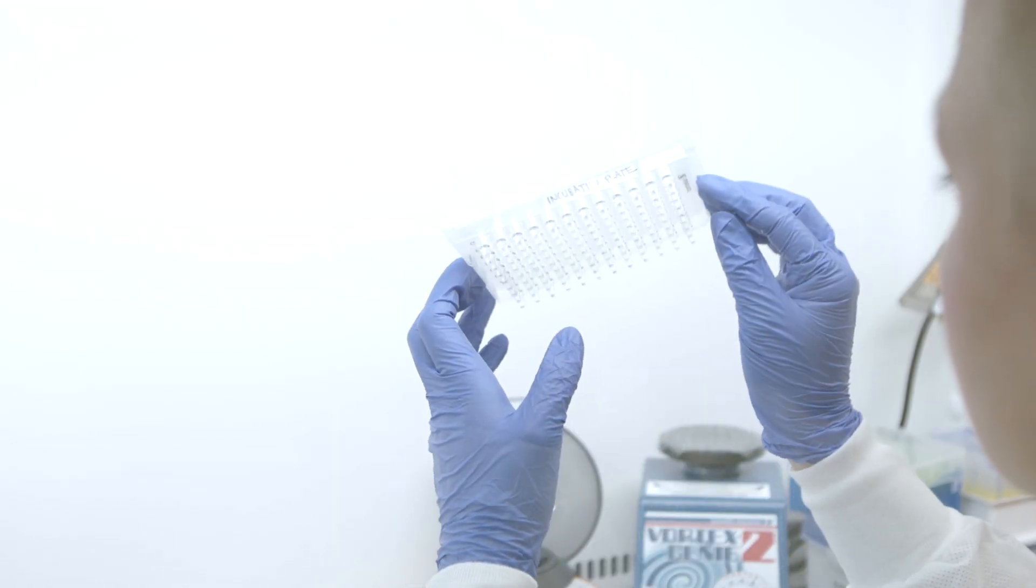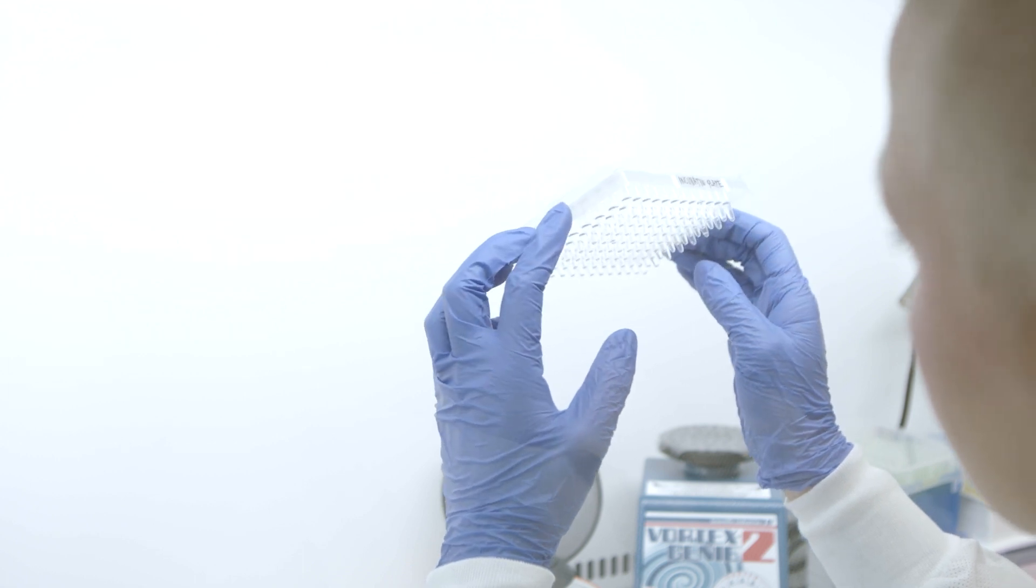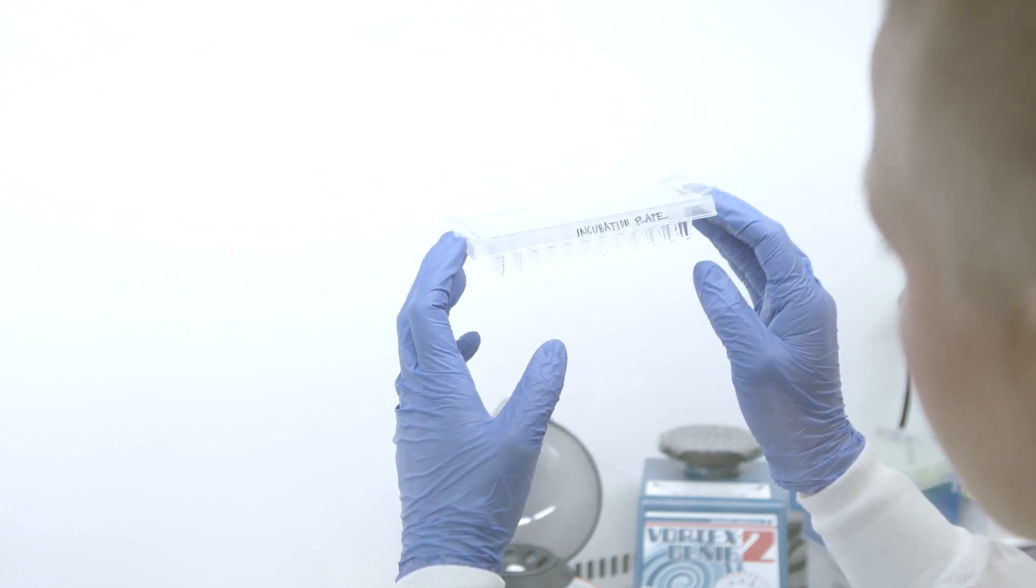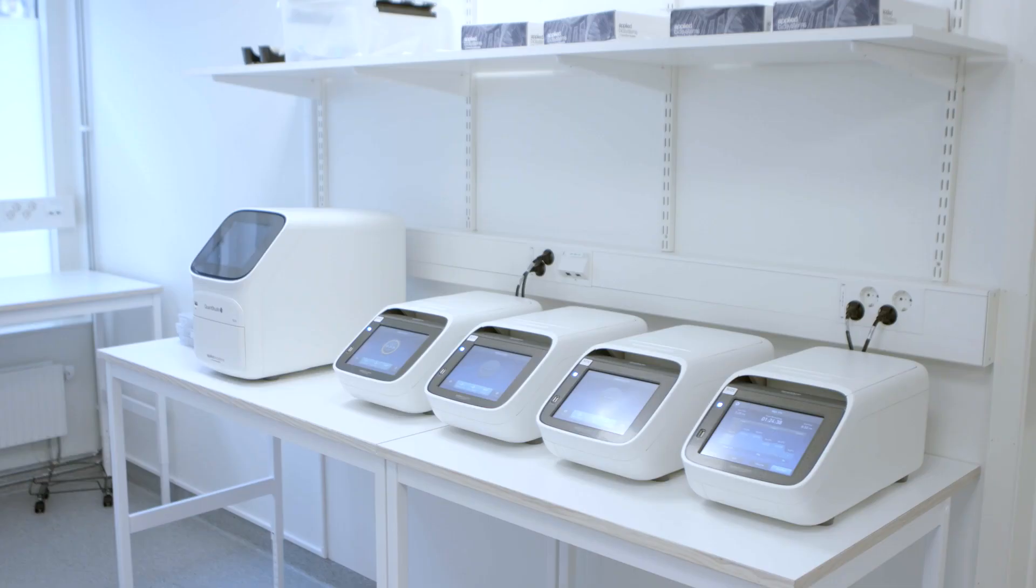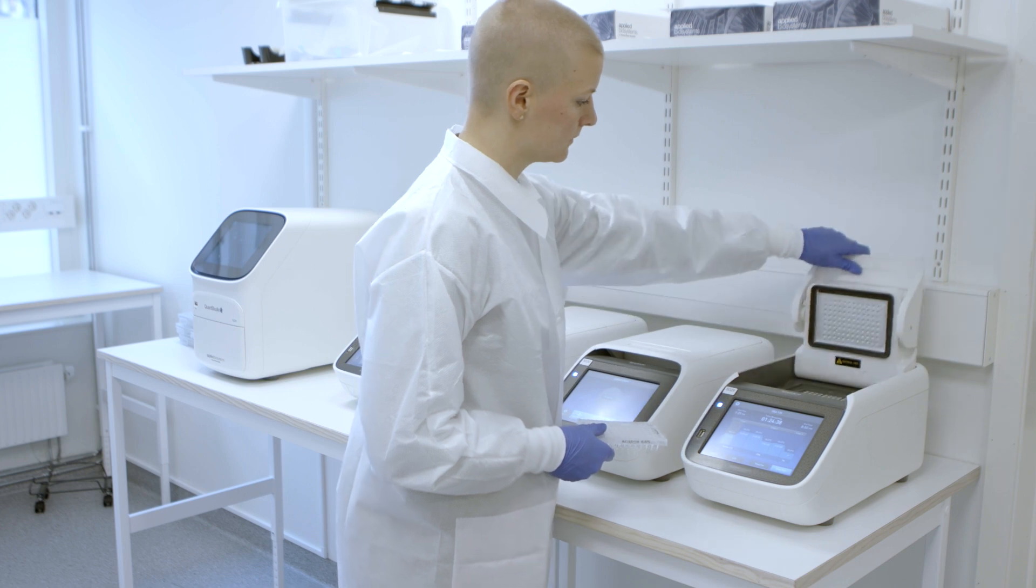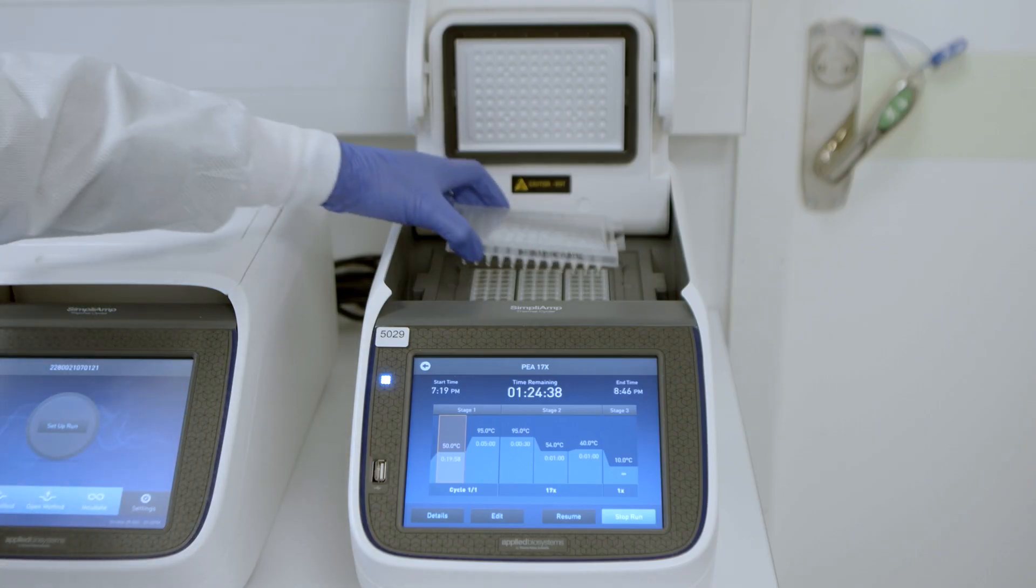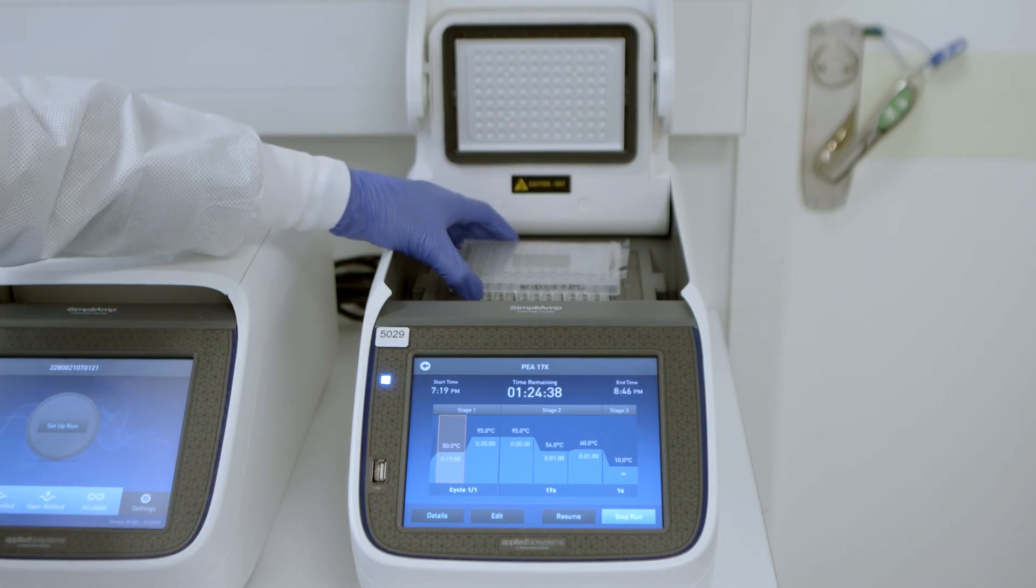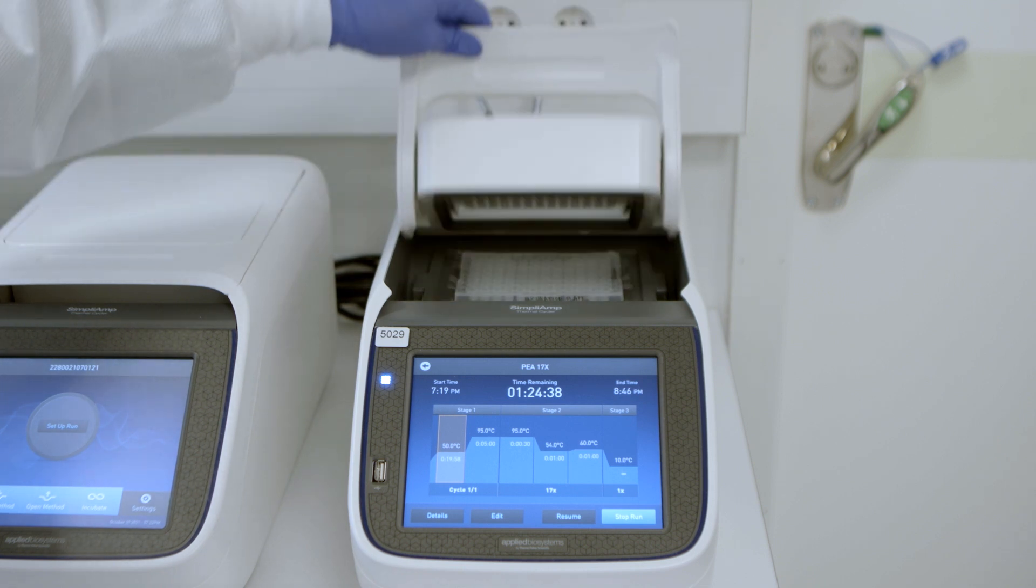Check that all wells in the plate contain the same volume and note any deviations. This information is required to interpret the data during statistical analysis. Transfer the incubation plate to the PCR room. Place the plate in the PCR instrument and resume the PCR program after 5 minutes have passed.